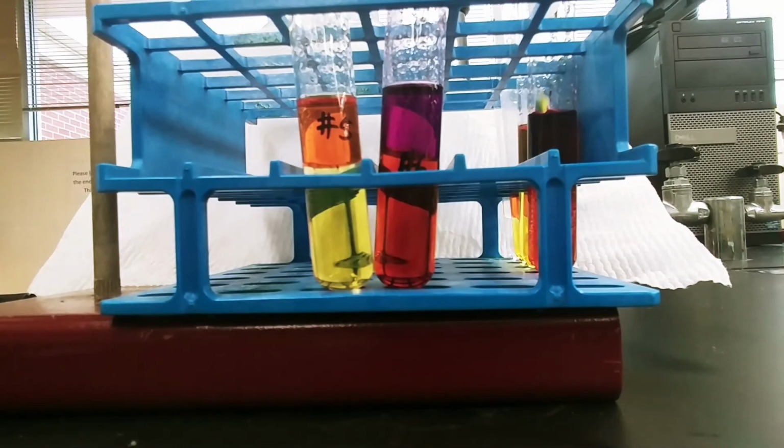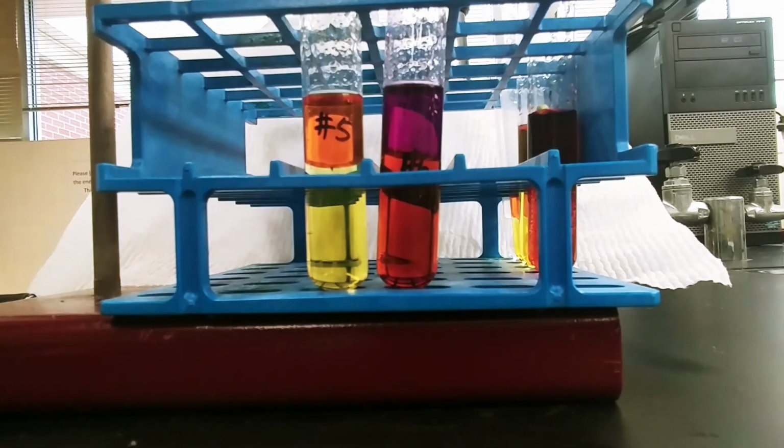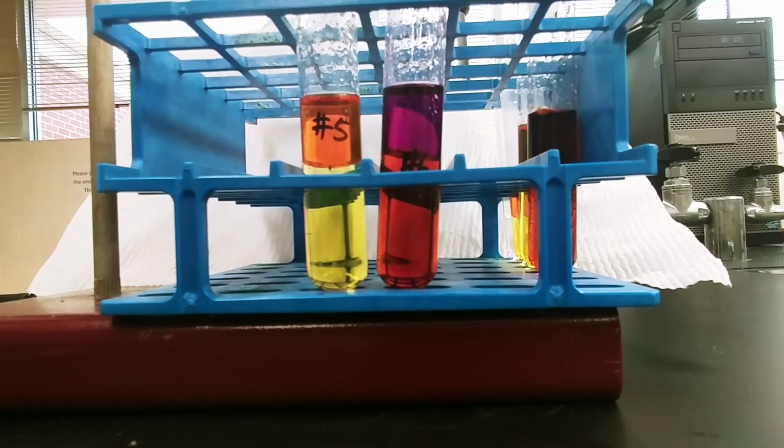Okay. All right, so that is the experiment involving redox with halogens. Again, we're using the color of our cyclohexane layer to decide what has been either left in solution as a neutral halogen or what has been produced as part of a redox reaction as a neutral halogen.